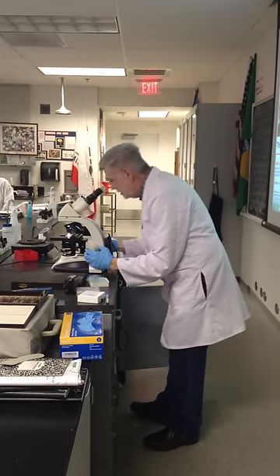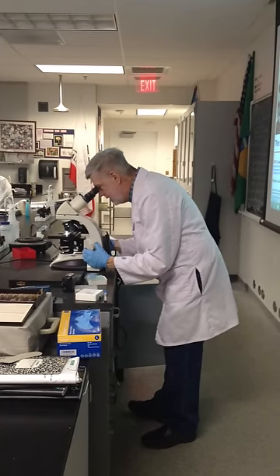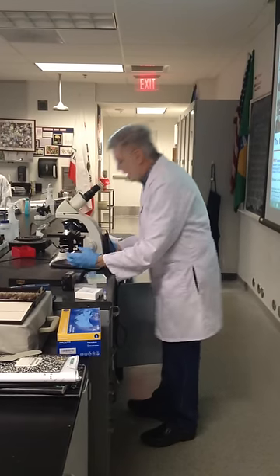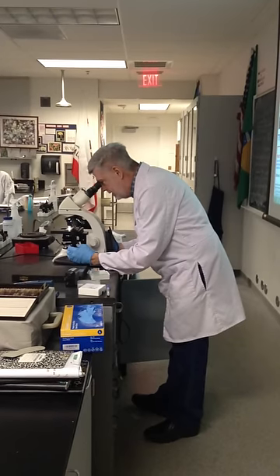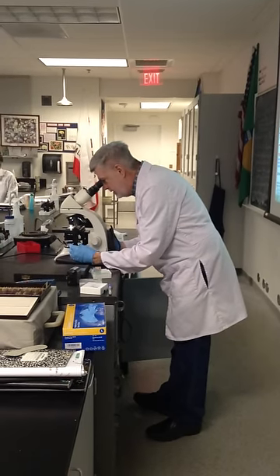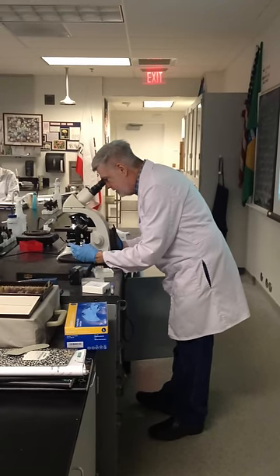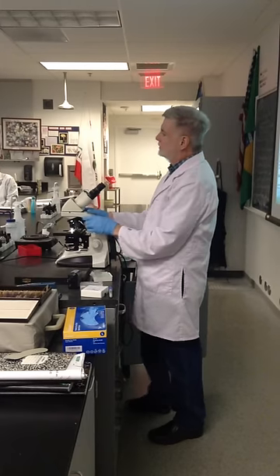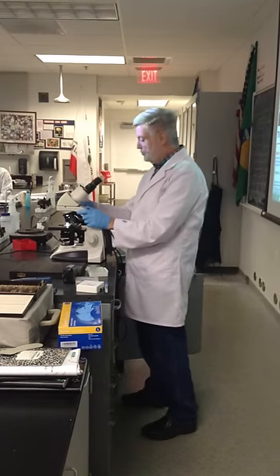In this case it will look pink because our stain is red — you'll see something like pink sand. If you see a white blood cell and want a closer look, put it at the end of the pointer. Anything you're looking at should be completely fine-tuned at the end of the pointer.